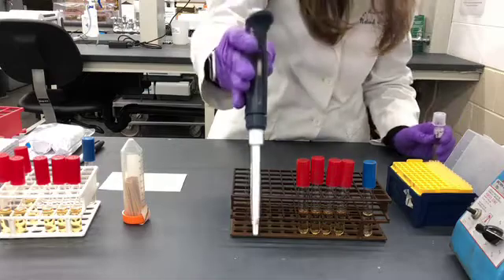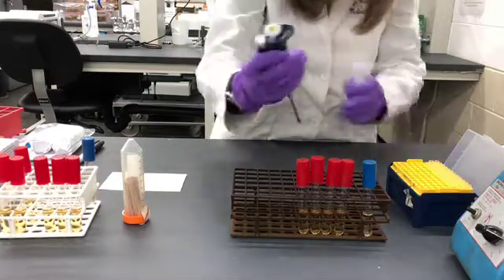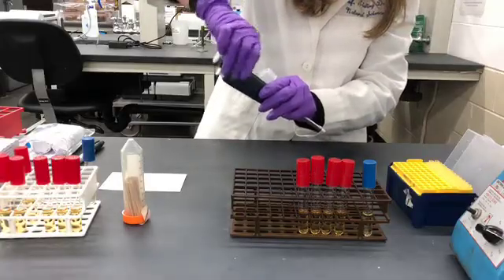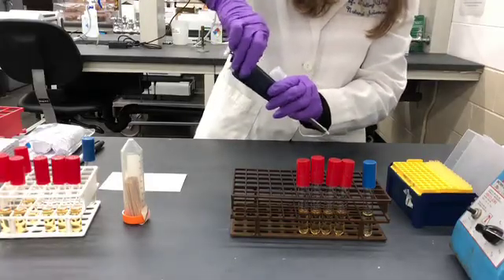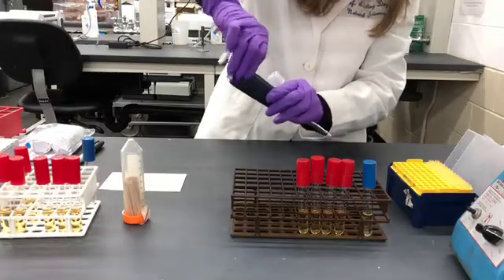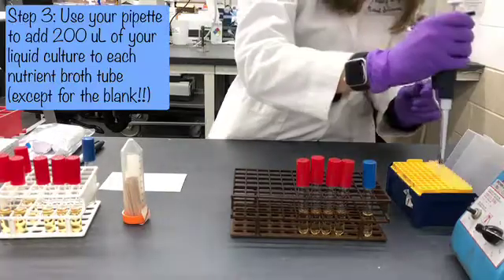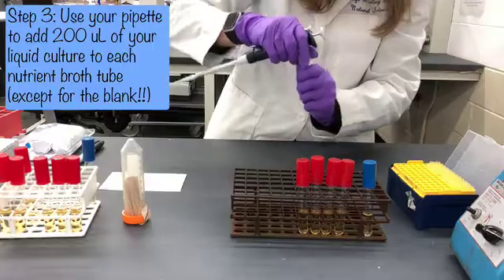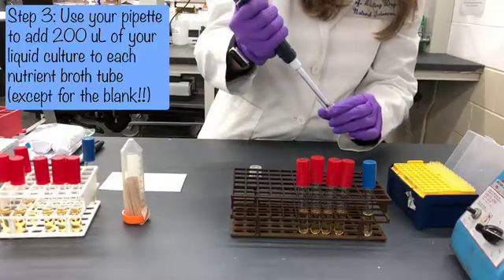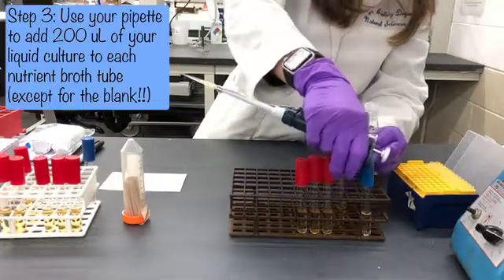We're then going to use our P200 pipette that can pick up up to 200 microliters, and we're going to use that to inoculate the four labeled tubes. We're going to leave the blank un-inoculated. This allows us to give an equal number of cells to each of these tubes.